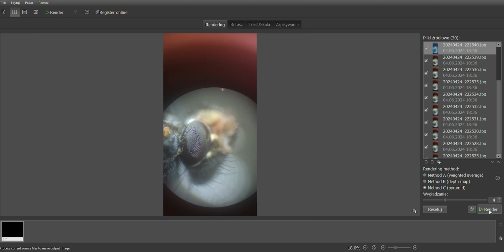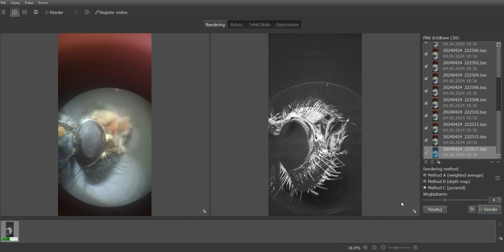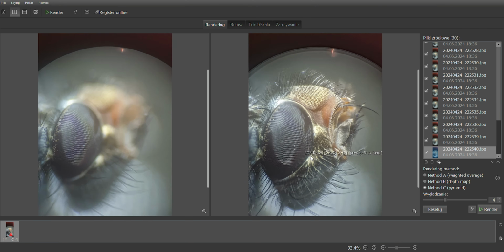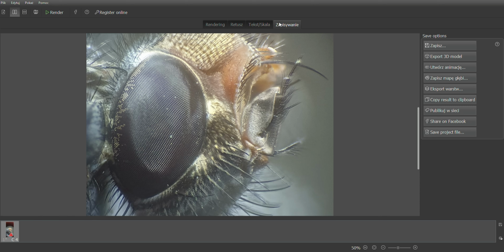Method C uses a pyramid-based approach, splitting image signals into high and low frequencies. It works well for photos of objects taken with reflected light. Once you've chosen the method and hit render, the software analyzes the stack and creates a single image, which you can then save.